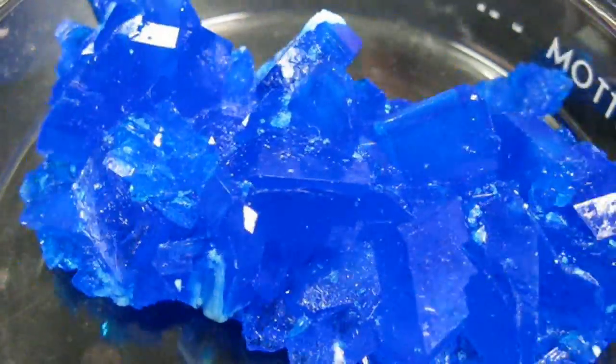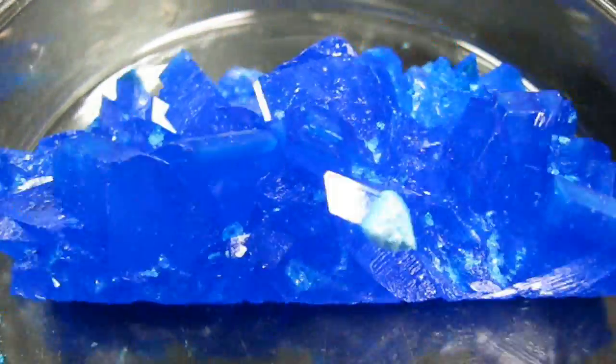If you want very large crystals, just let the mixture evaporate instead of boiling it. And eventually you'll get these nice large crystals of copper sulfate.